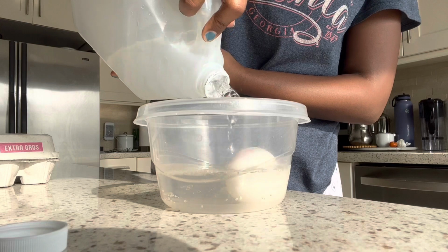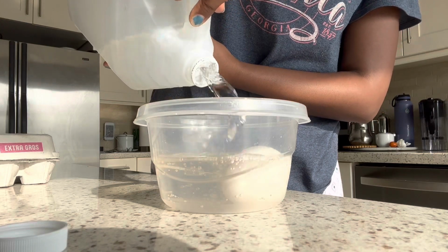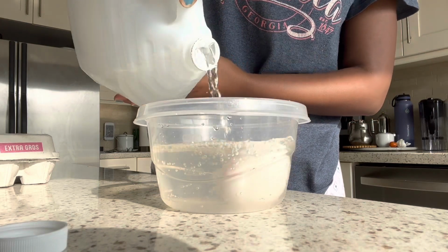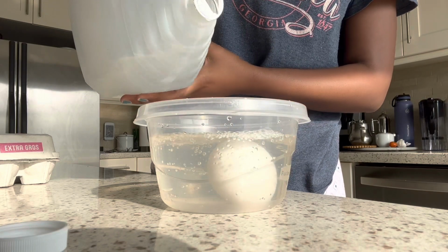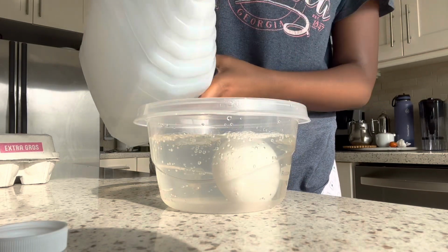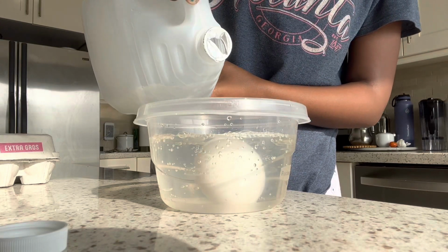In this video, I will show my egg, who I named Egna, and her 5-day transformation. The purpose of this lab is to see the diffusion of water in different tonicity solutions. We will see the egg's shape change, difference in tonicity, concentration gradient, and the volume and turgor pressure.